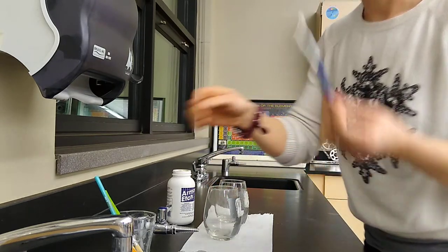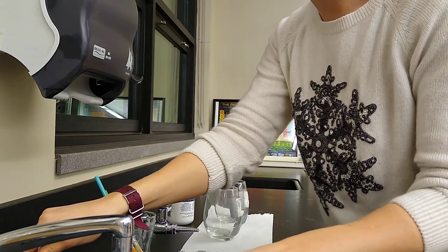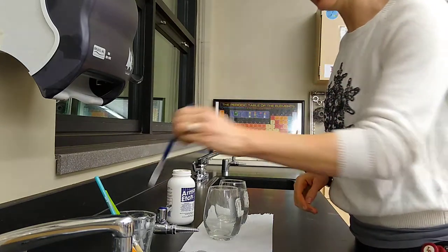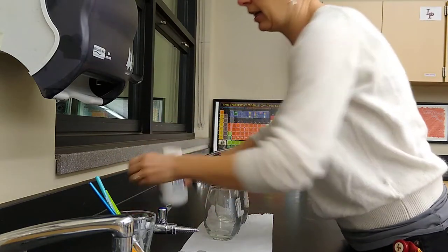You're gonna let that sit. Rinse off your brush and put it back in the glass. You don't have to touch it, just put it back in the glass, and then again, close that lid really tightly.